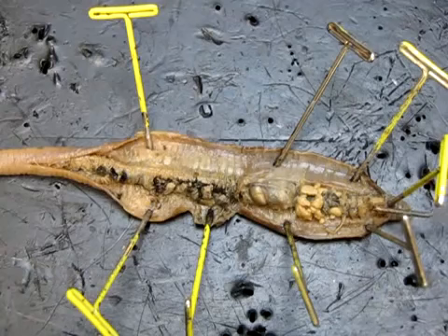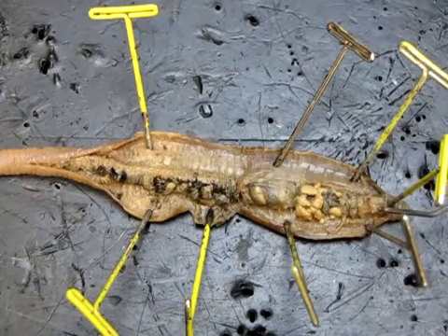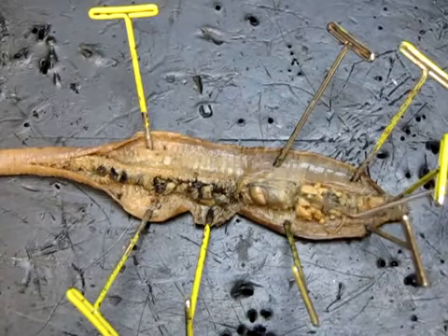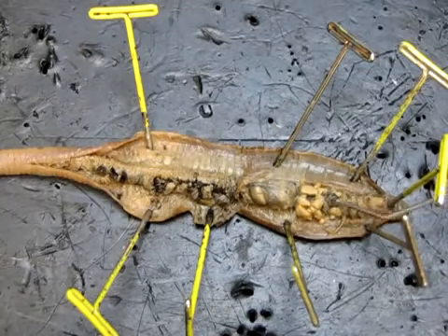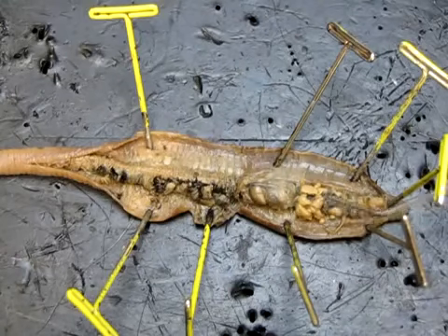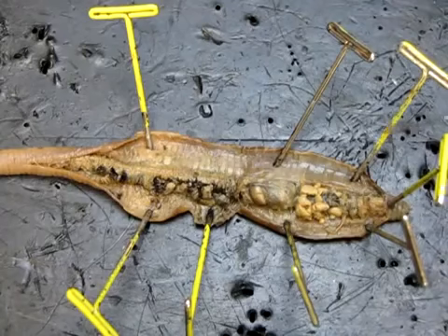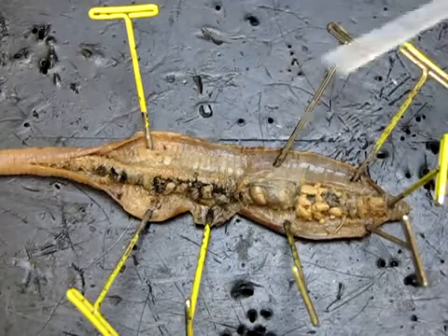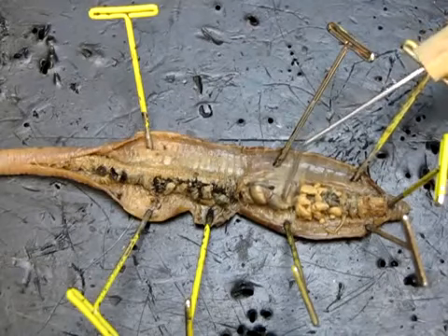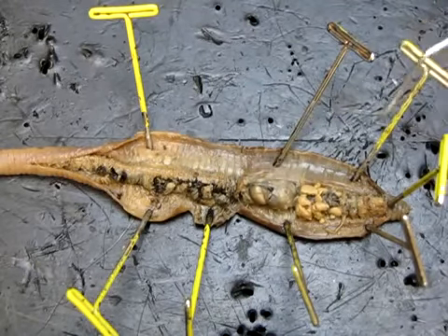That opens into a short pharynx, which is just this pale bit of tube right here. The pharynx then opens into the esophagus, which is actually difficult to see because it lies underneath all of these other structures on top we're able to see here. We'll come back to these, but know that beneath this lies an esophagus, which is just the next part of the tube of the digestive system. The esophagus opens up to this thin-walled sort of bag, this little structure right here. This is called the crop.